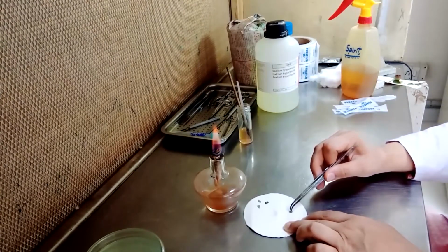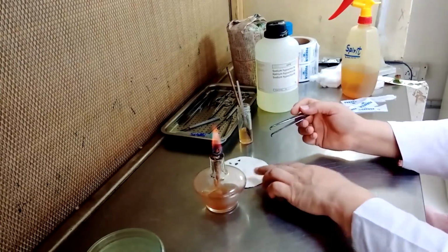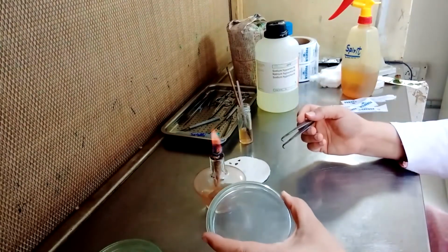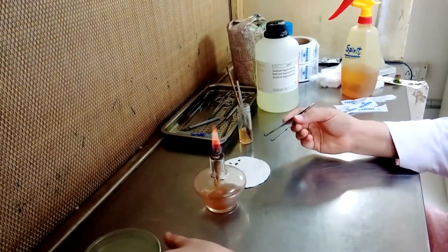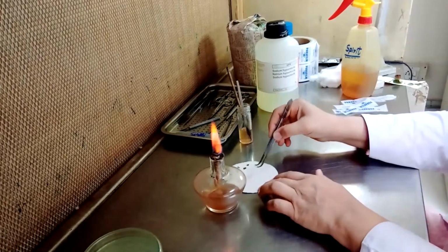Bacteria is a bit fast growing as compared to the fungal growth. When you inoculate in your media, the very next day it may fill with the bacterial colonies. So you have to be very patient to get your samples dried.